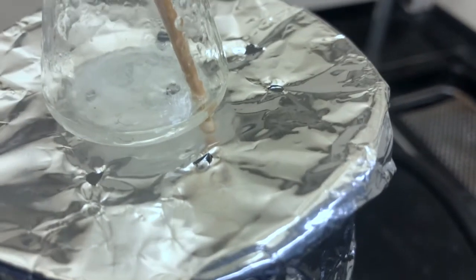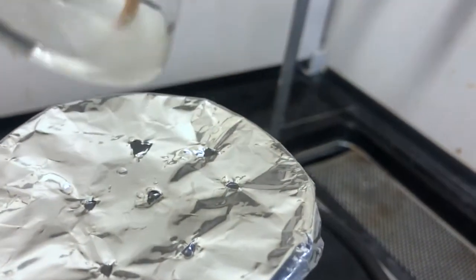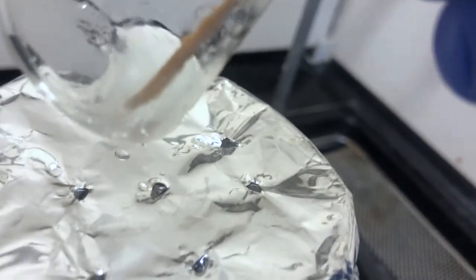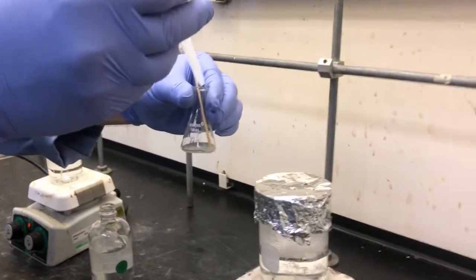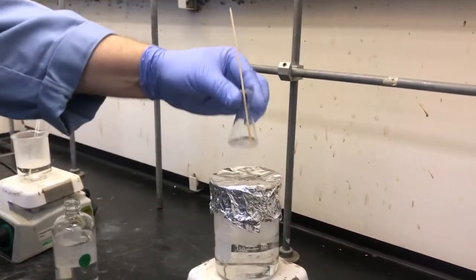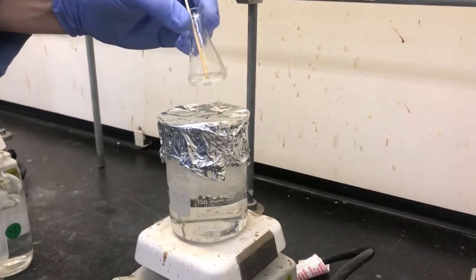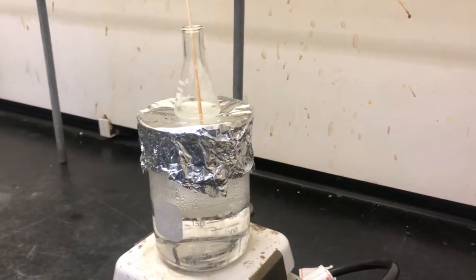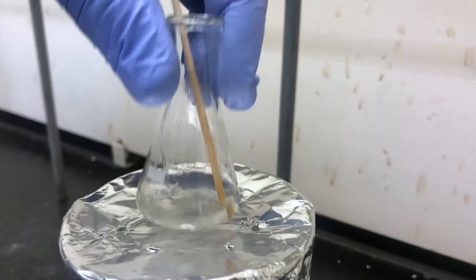So now we're waiting for the solution to boil nicely. Once it seems to be starting to boil or get close to boiling, we can tell that the solid still has not completely dissolved. We wash down the sides to try and get the material off the sides, and then I add a little more 95% ethanol. I should have added 1-to-1 ethanol water. So this is to finish the dissolving process. At this point, the solution starts to clear up fairly well. You can see there's very little visible solid now.